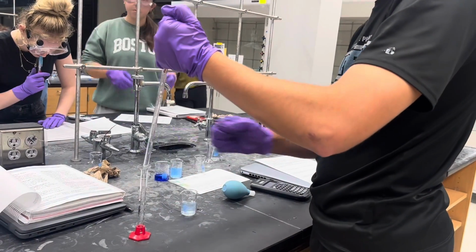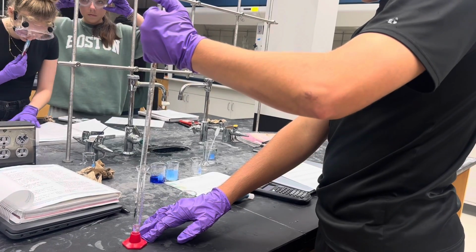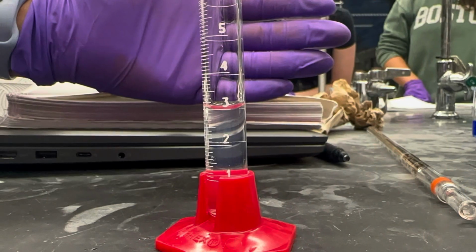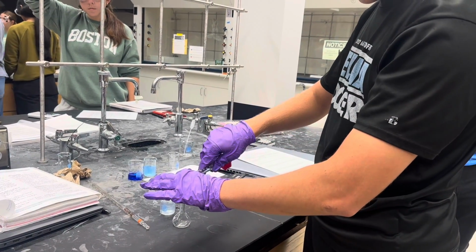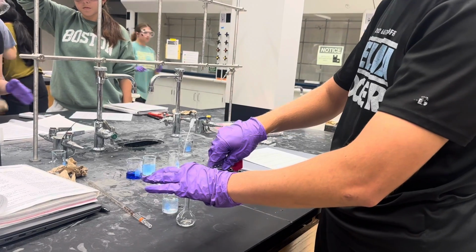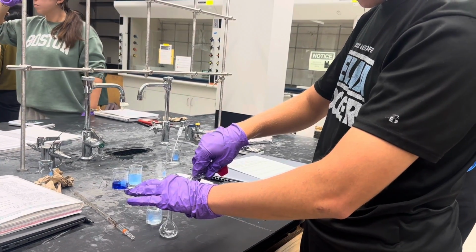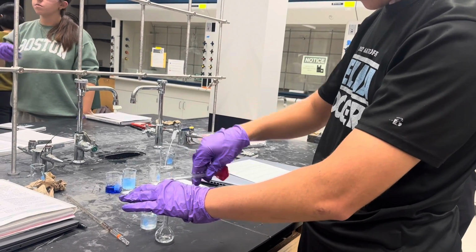The stock solution is a concentrated form of a chemical solution that is being used for the dilutions. A dilution is made by adding solvent, usually distilled water, to a measured amount of the stock to lower its concentration. The concentration and volumes of these solutions are used in the dilution equation, which works because the moles of the solute remain constant while only the volume changes. This allows for a calculation of a specific dilution concentration.